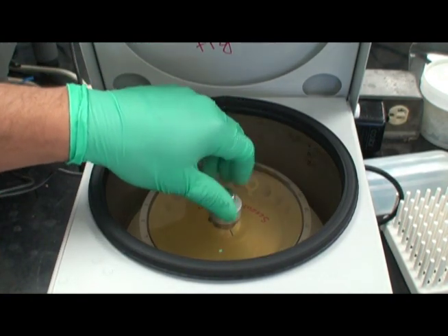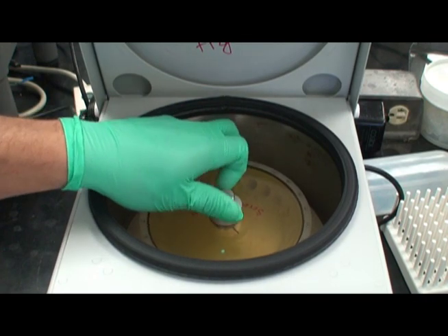Once complete, screw on the safety lid, close the outer lid and press the start button.